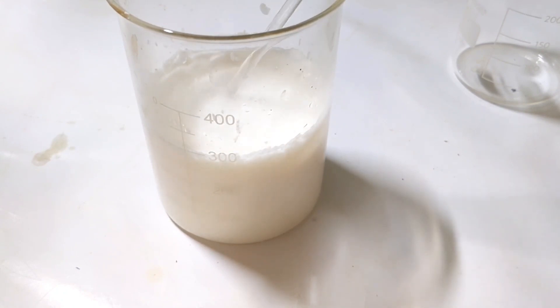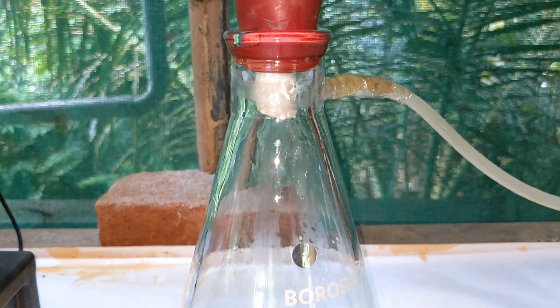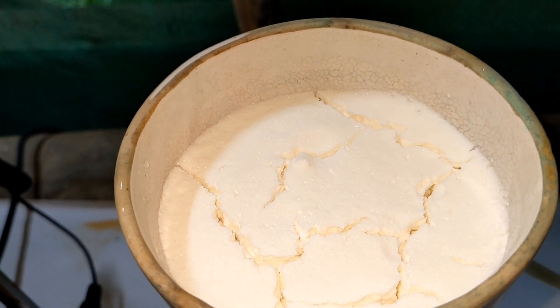This was then filtered. I used a vacuum filtration for very easy filtration. And you can see the crude cake of benzoic acid here.